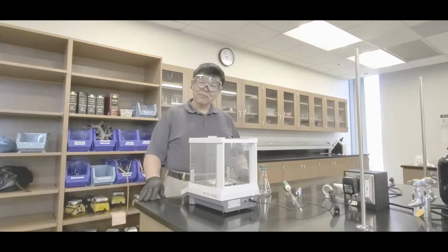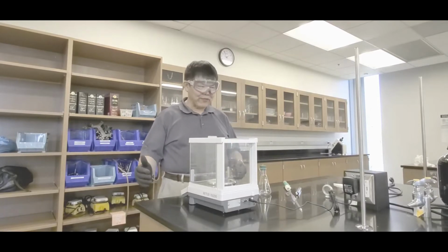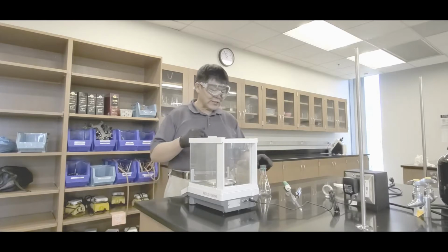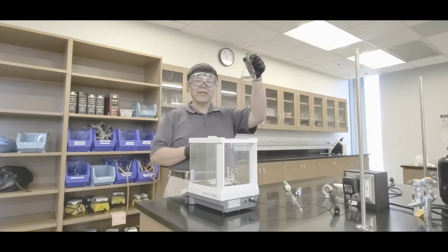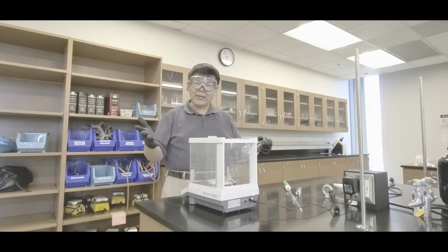All right, class. What I'm going to do is this. I'm going to show you guys how to do the density part of this experiment first. And then I'll show you how to do the boiling point next. And then we'll show the index of refraction, okay? So what you need to do is this. First thing is to go and get the empty flask with the stopper. And what you want to do is weigh it, okay?